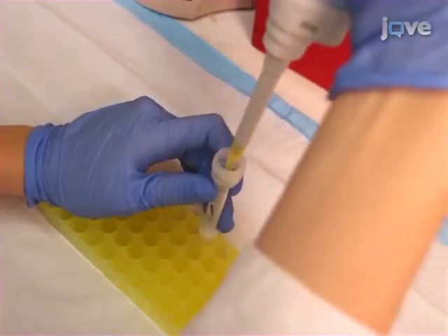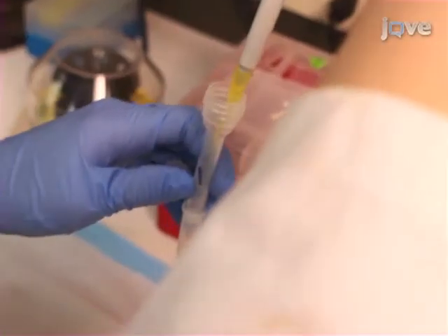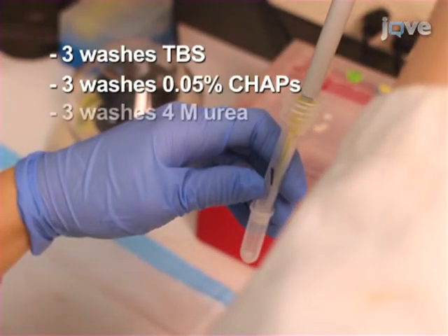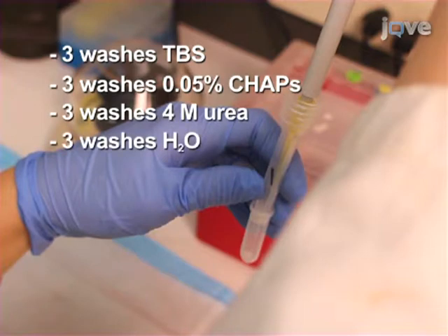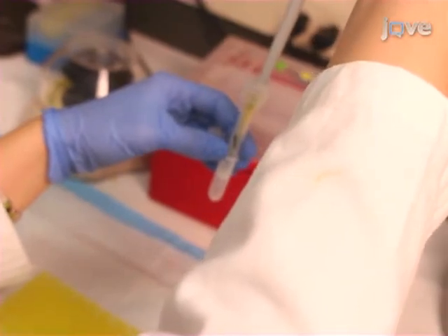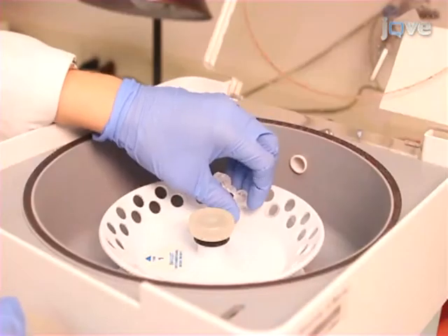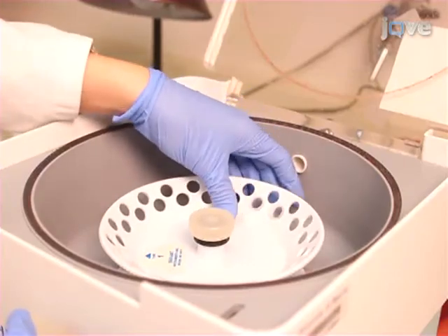Load each sample on a column. Perform column washes of 200 microliters each. Then, elute each sample 3 times with 200 microliters of 50% elution buffer and dry under vacuum.